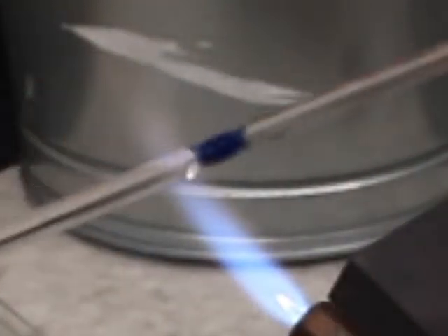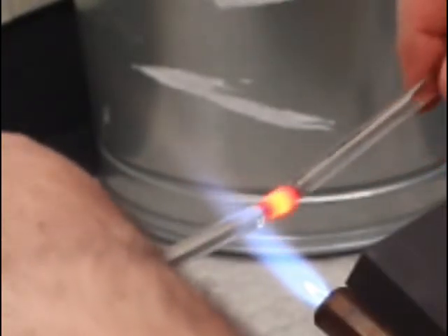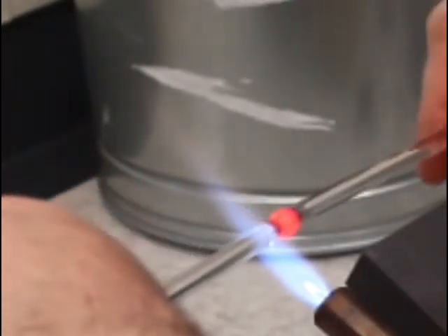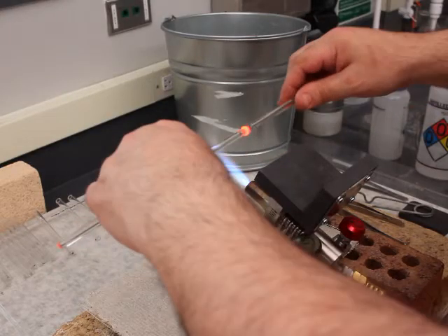Now I took those scraps of blue glass, and what I'm going to do here is simply make a Maria. I already have another video of making a Maria, but it's one of those things where I didn't want to waste the glass, and it is good practice. The reason I'm using, again, the blue glass is to give a contrast of what I'm doing, to make it a little easier to see.